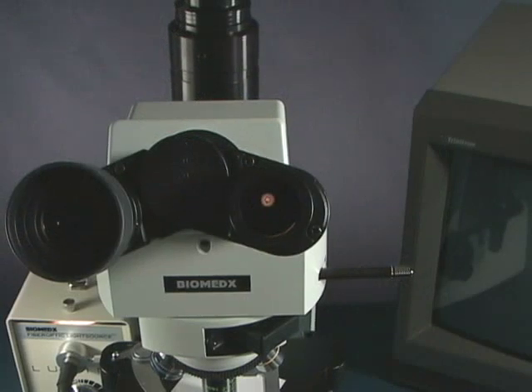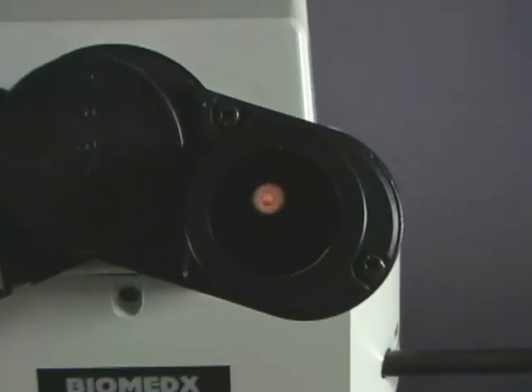Looking down the center of the tube, we look right down the center. And what do we see? We see a circle and the dot isn't even anywhere near the center. So we take our adjustment screws, push it in, and start rotating our phase contrast adjustment screw. Do one side first.